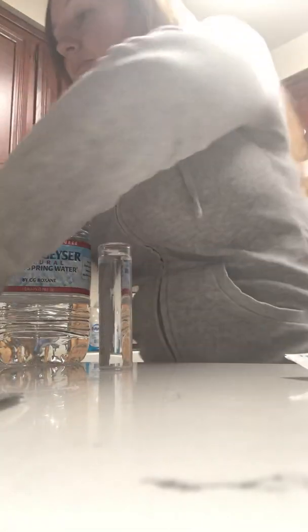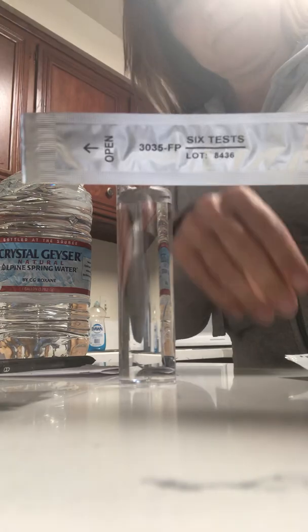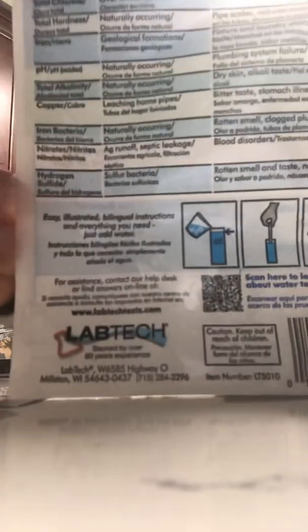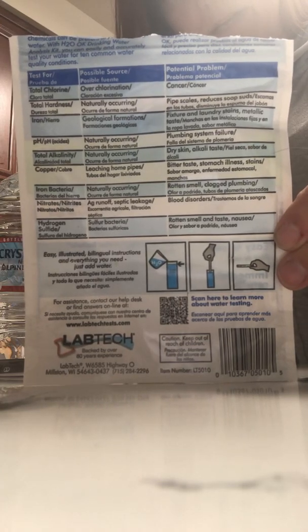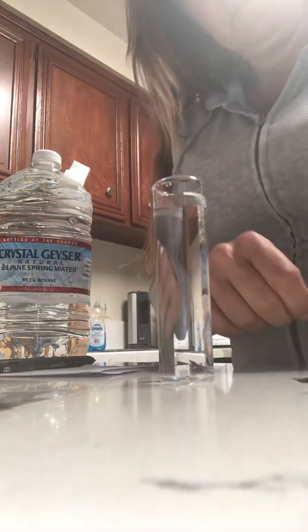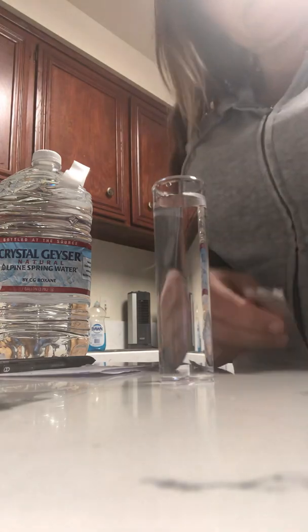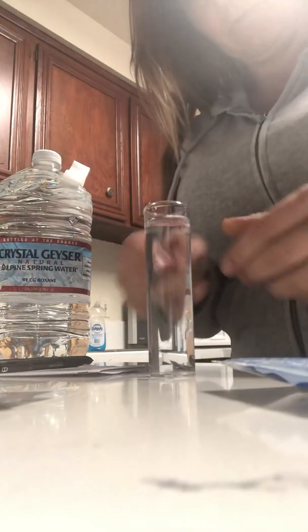The first one we're going to do — I'm going to have my paper ready to write it all down. We're going to do the six test. Here are the tests that this test will do. You can pause it and read it. But the first one is cancer — look at that. And that is the chlorine test. The first line on here is the chlorine cancer test, but it's not the first one on the test strip.